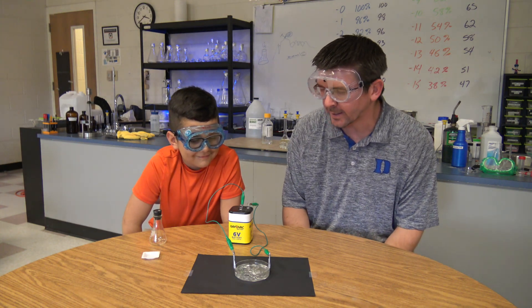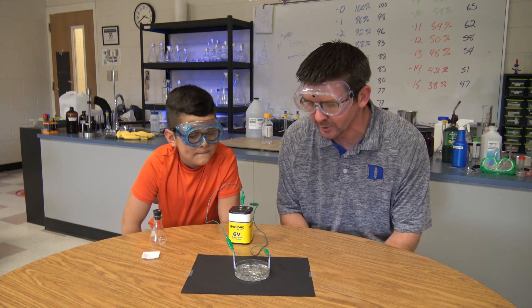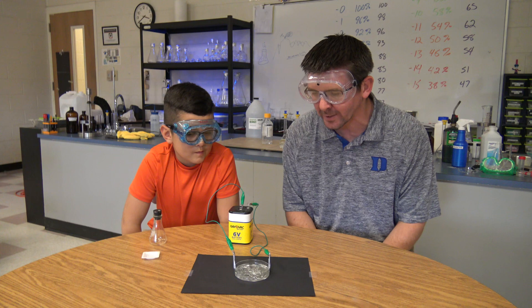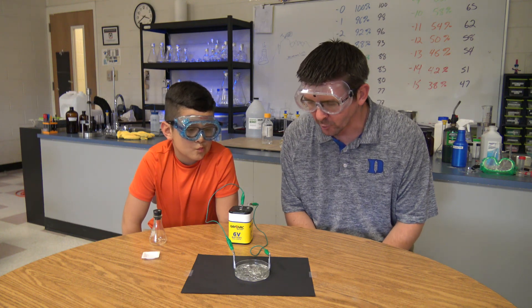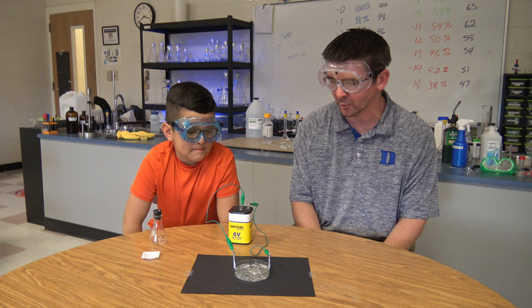So this is that idea of electrolysis — using electricity to drive a chemical reaction — which is a pretty cool reaction here, a pretty neat demonstration of that concept and just a great way to actually see metallic tin being crystallized out like that from tin(2) chloride solution.